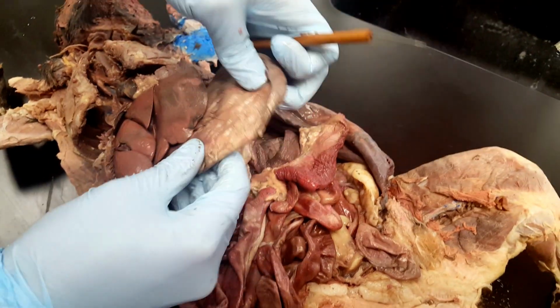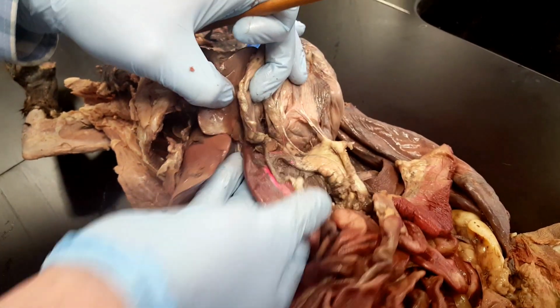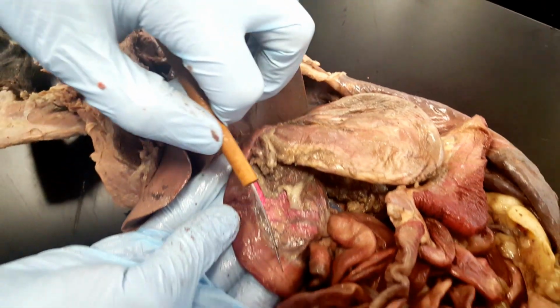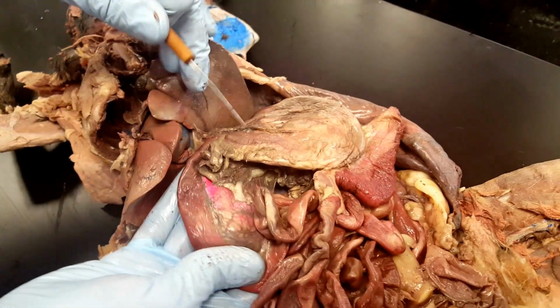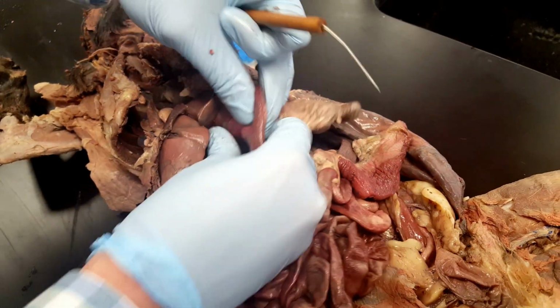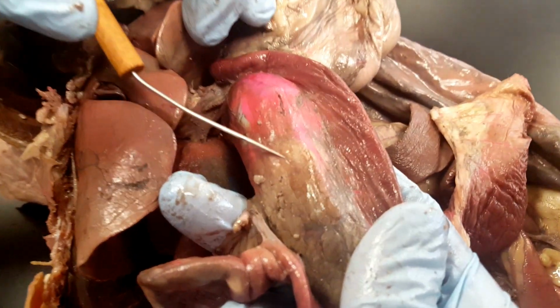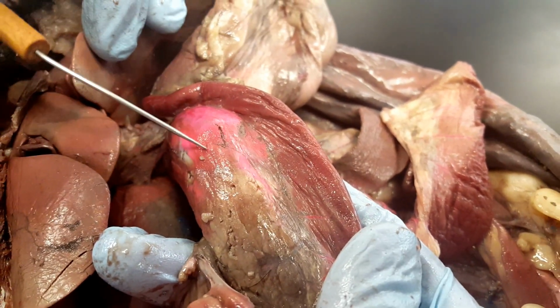Now if you follow the body of the stomach, you'll reach the beginning of the small intestines. It transfers from the body of the stomach here into the beginning of the small intestines, which is the duodenum, which is going to form sort of a crescent shape. And if you look on the inside of the duodenum, there's sort of this grayish matter. It's a little hard to make out, and that's going to be the various parts of the pancreas.